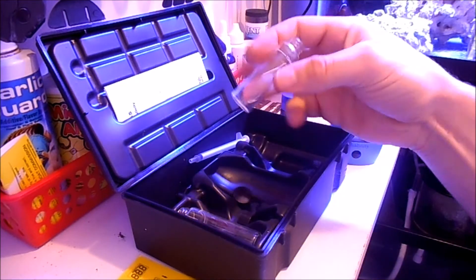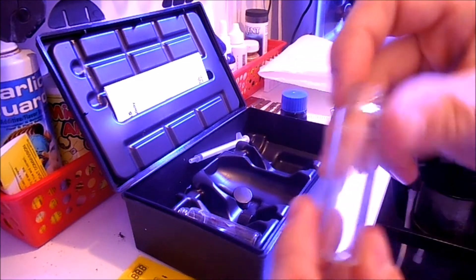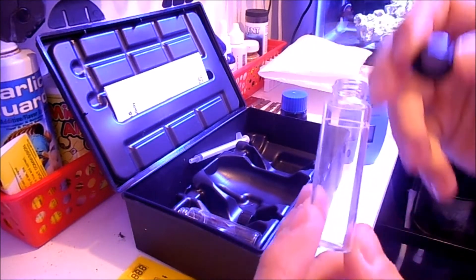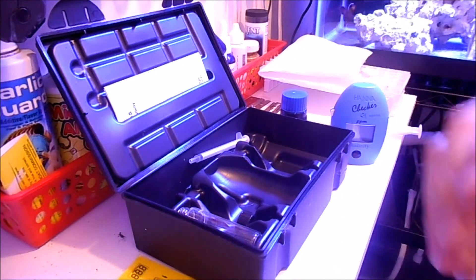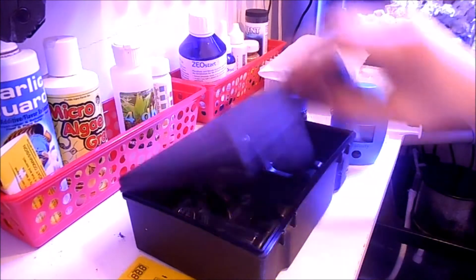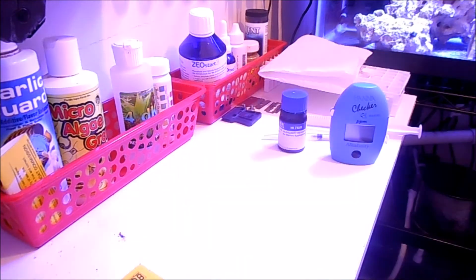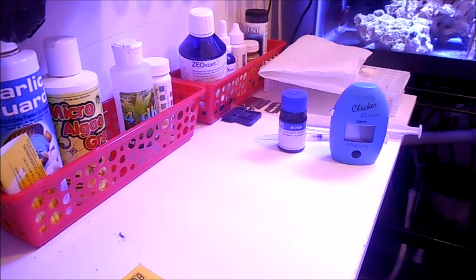It comes with two of these vials, which have the 10 milliliter line on there, and a cap. Okay, let's get started.